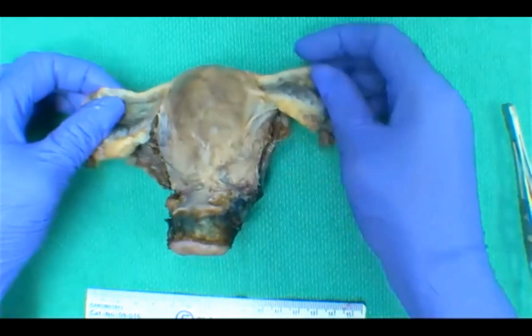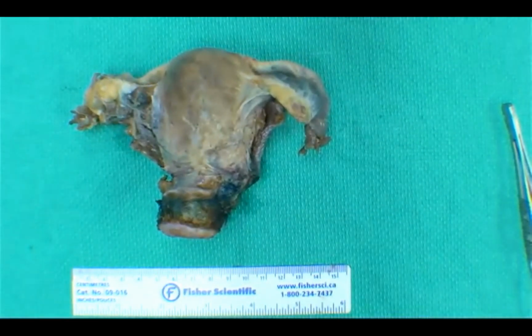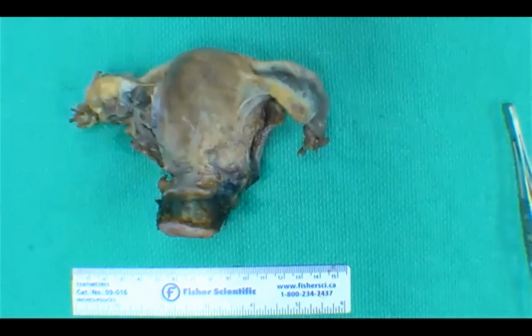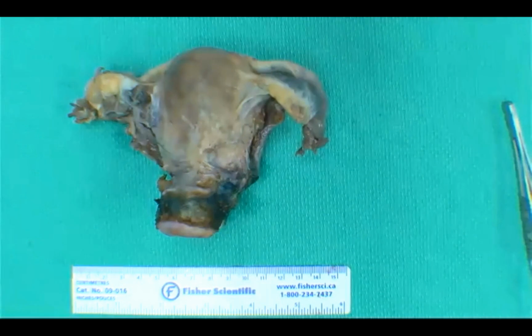Okay, let's do some discussion now. Can you tell me what are some benign reasons why we would receive a simple hysterectomy with a bilateral salpingo-oophorectomy specimen? Okay, great. Seeing some good answers. So adenomyosis. Wonderful. Prolapse. Fibroids, endometriosis. Great answers. Yes. Prophylaxis. I think I saw one there. Yeah. And for clarification, can someone spell out what AUB is?